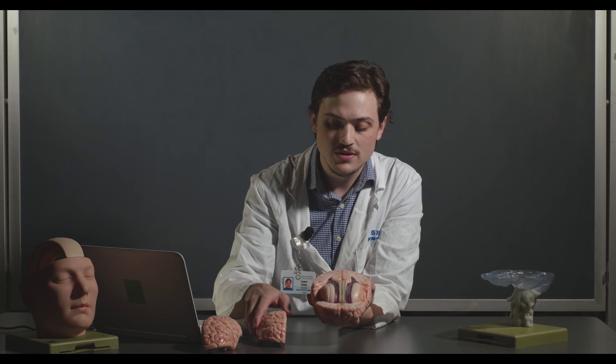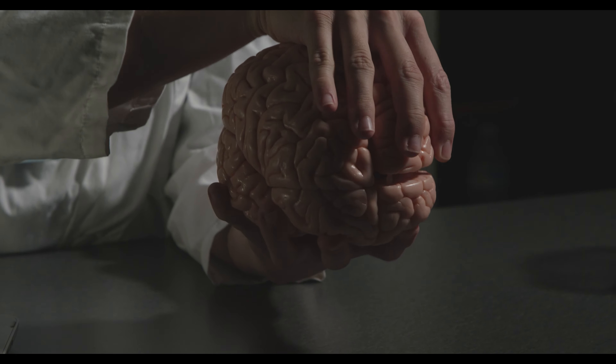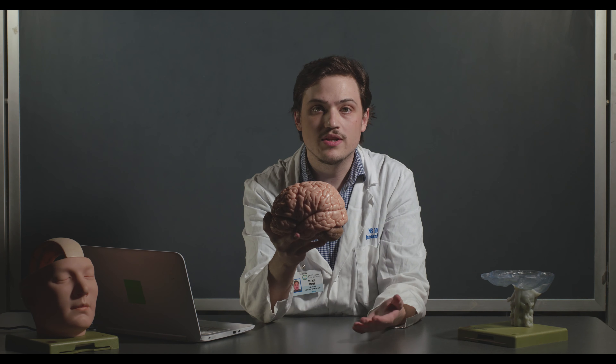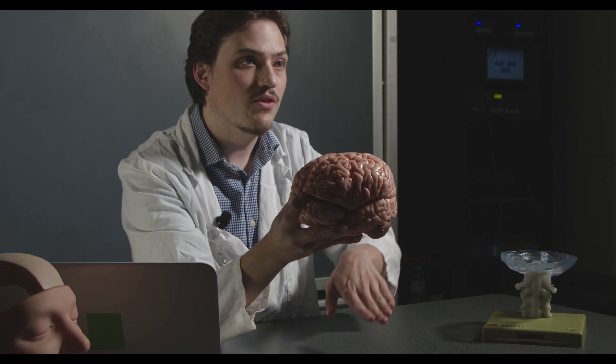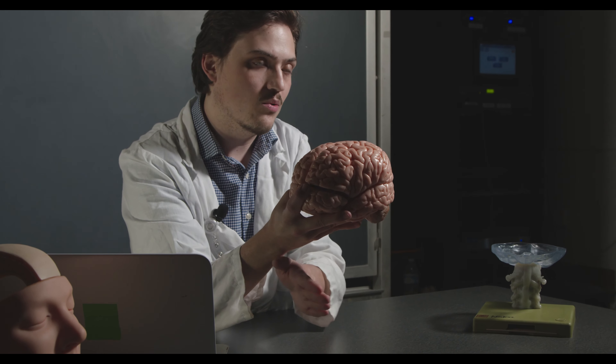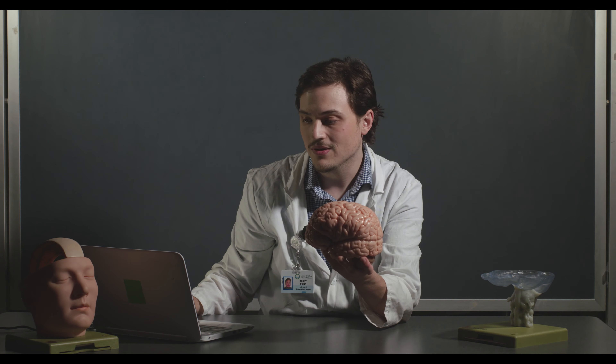One other thing about dorsal and ventral: in animals, the dorsal-ventral axis is a little different than in humans because we are bipedal. In a dog, deer, or horse, the head tilts up and the spine goes horizontally, so dorsal and ventral line up differently. In humans the spine curves. Anterior and posterior remain consistent across species, but keep this in mind when dorsal and ventral seem inconsistent.